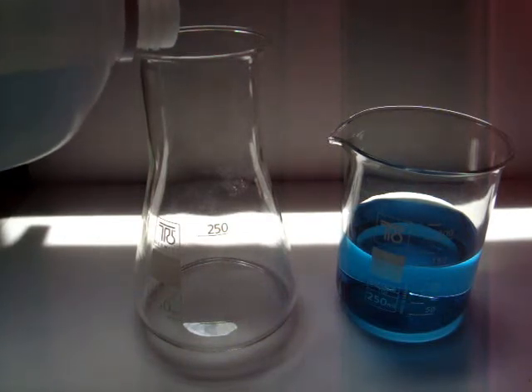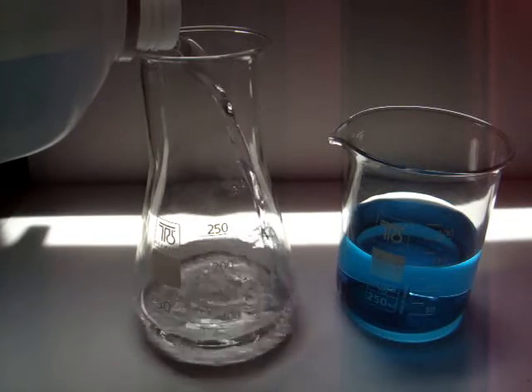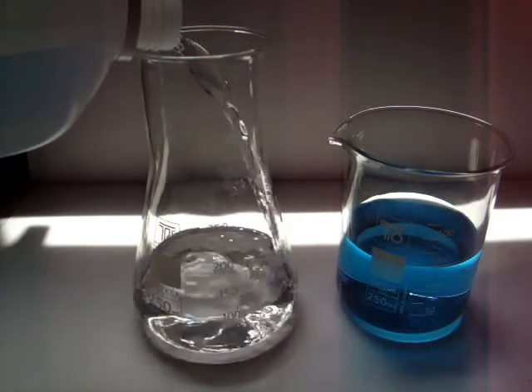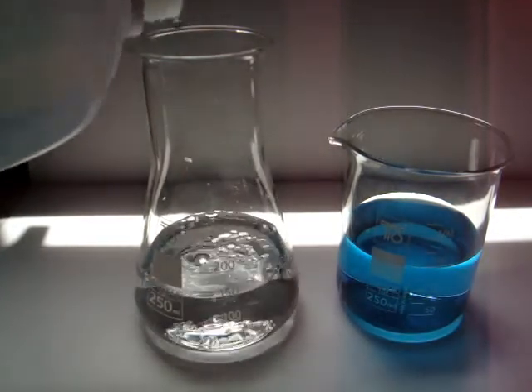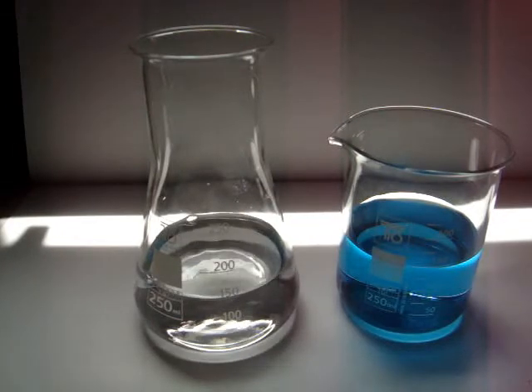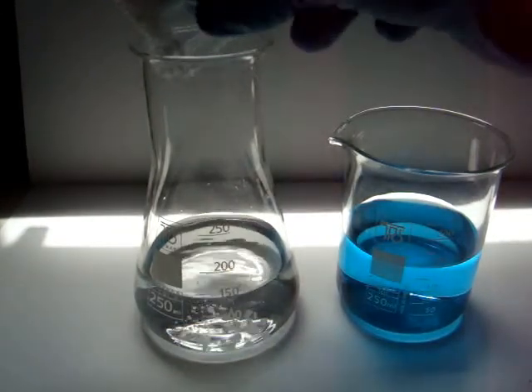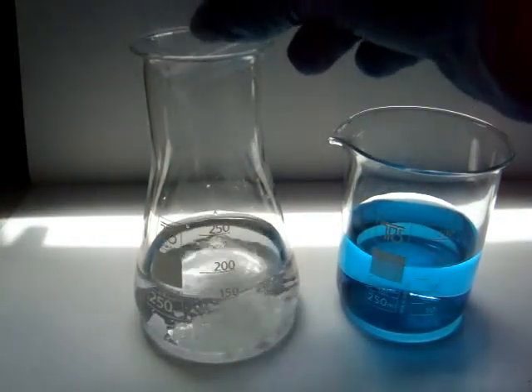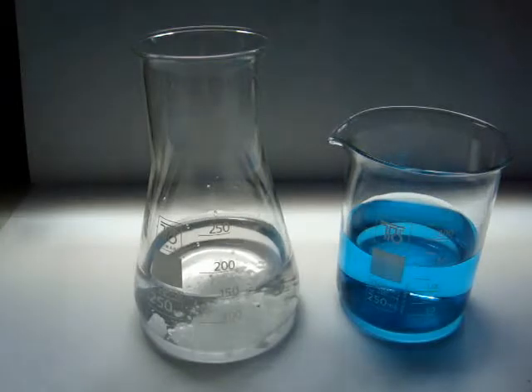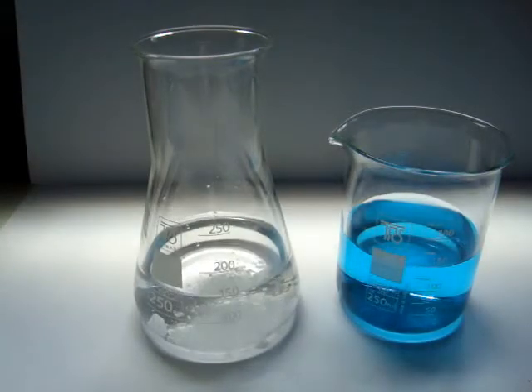Here we are. Now add the sodium hydroxide. Stir them like you have already done for the copper solution.